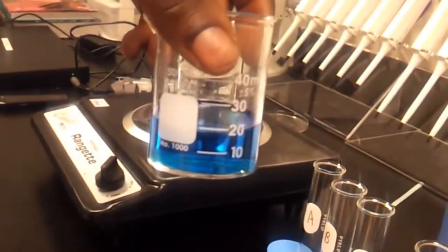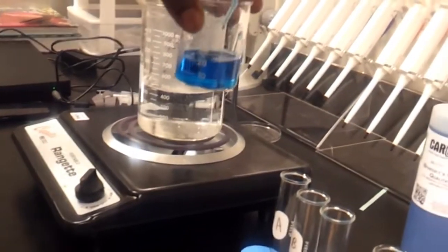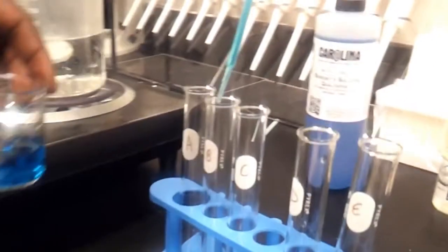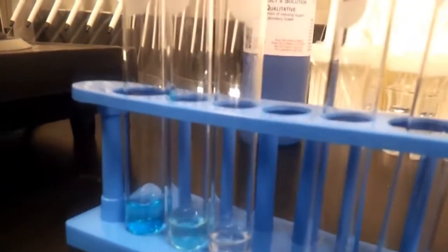Now, this is my Benedict solution here. Note that my Benedict solution has this nice, pretty blue color to it. Really, what tests for a positive test for Benedict solution is you'll get a color change from this blue solution.